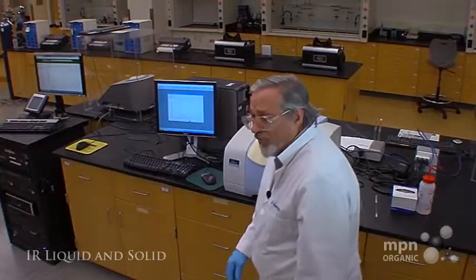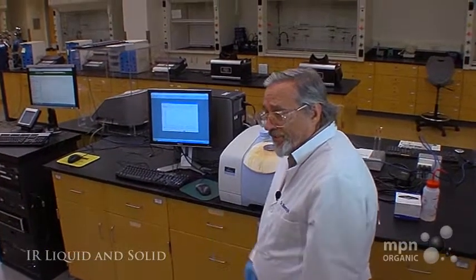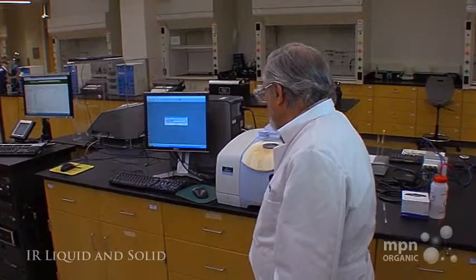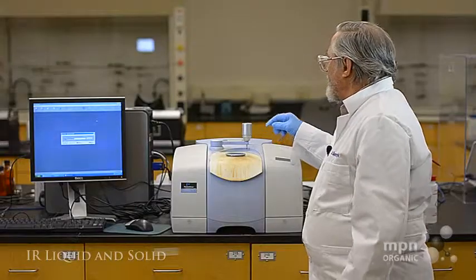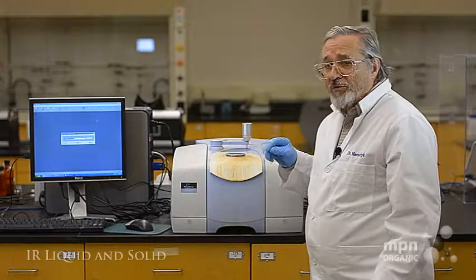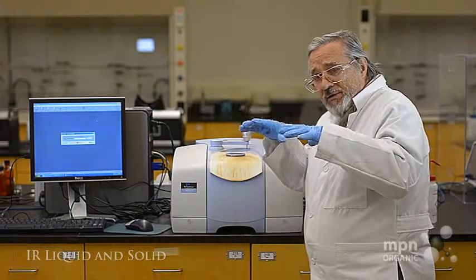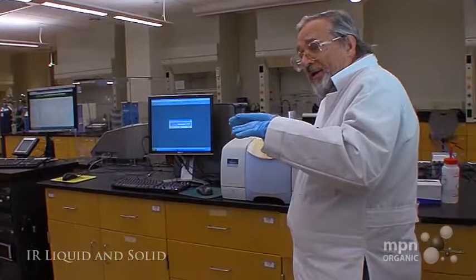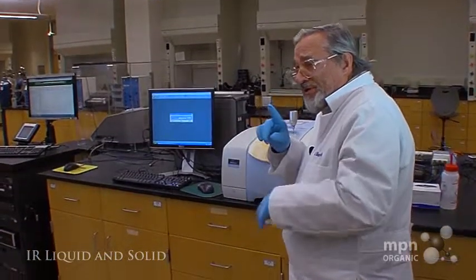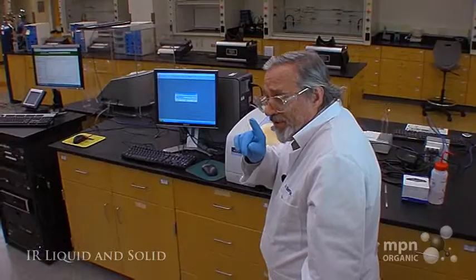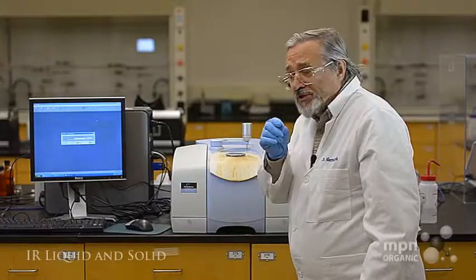It'll take a short while to go through the process of taking the infrared. And notice that I just put one drop on there, and that drop spreads out over that center portion, and it covers it, and that's the difference that we'll see between taking an infrared of a liquid and a solid.